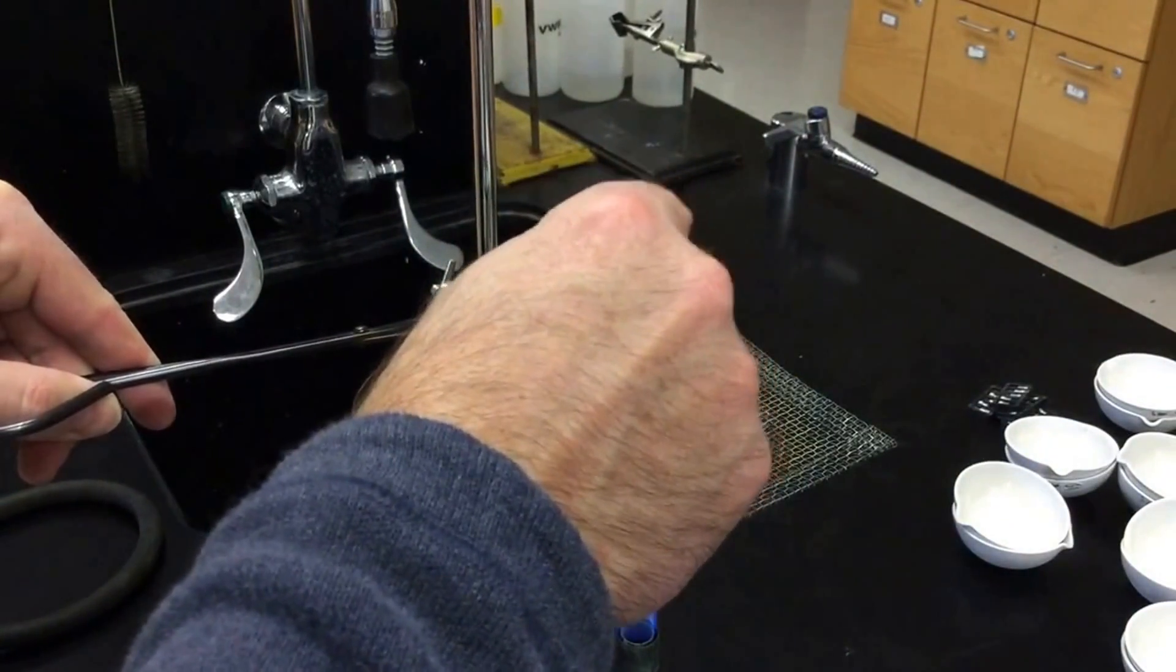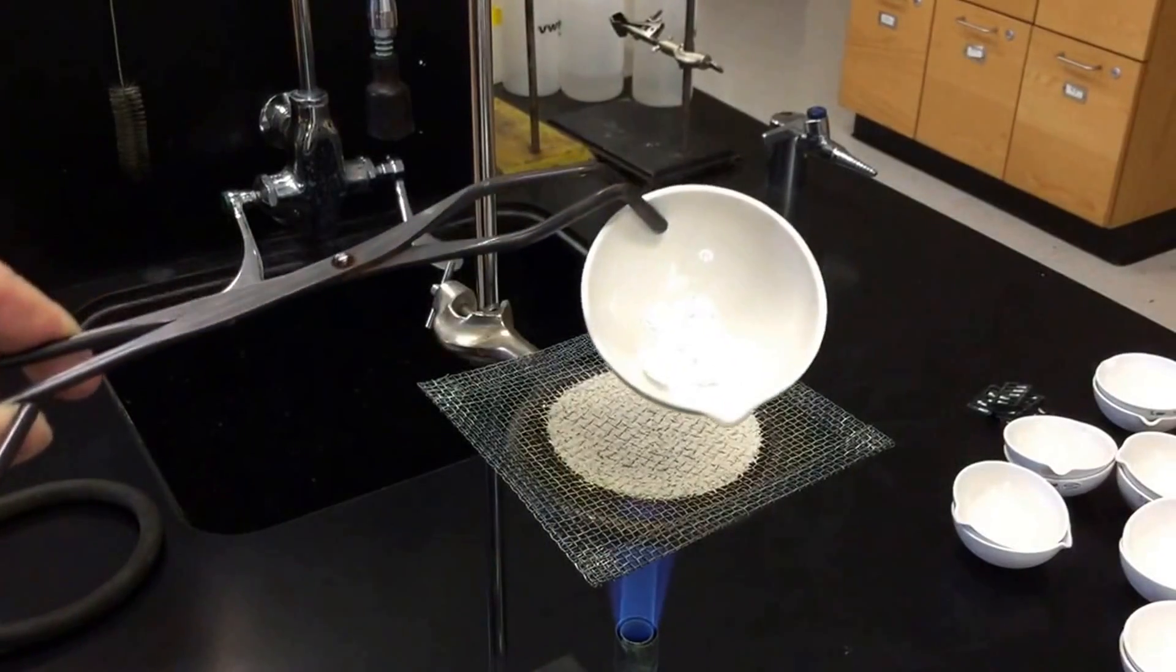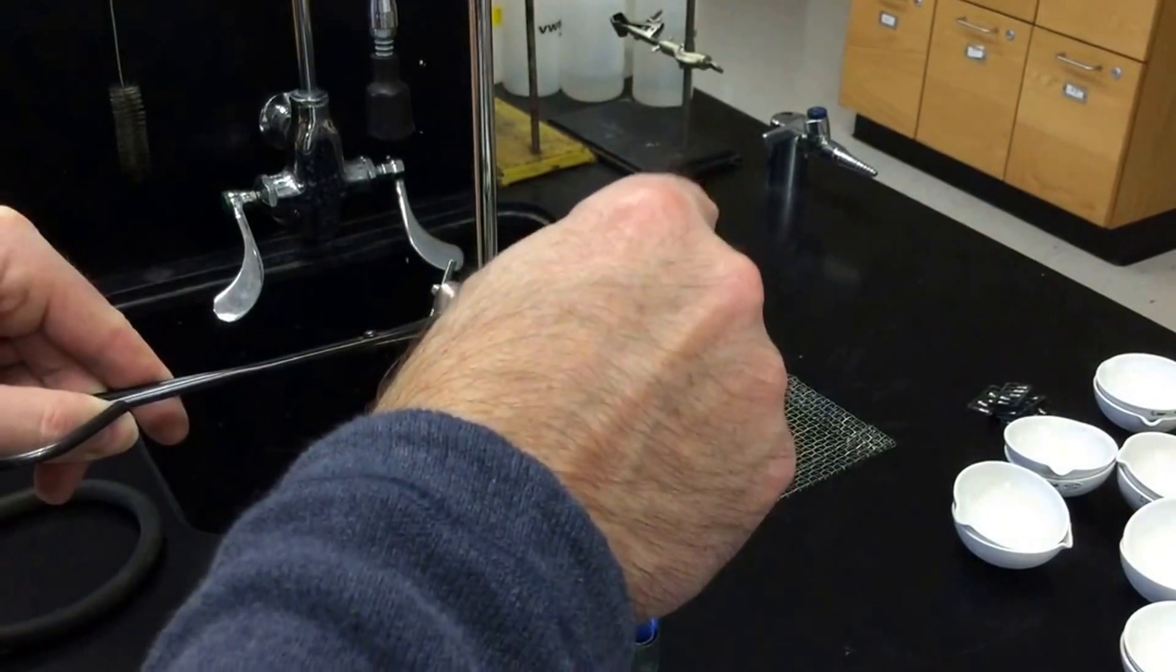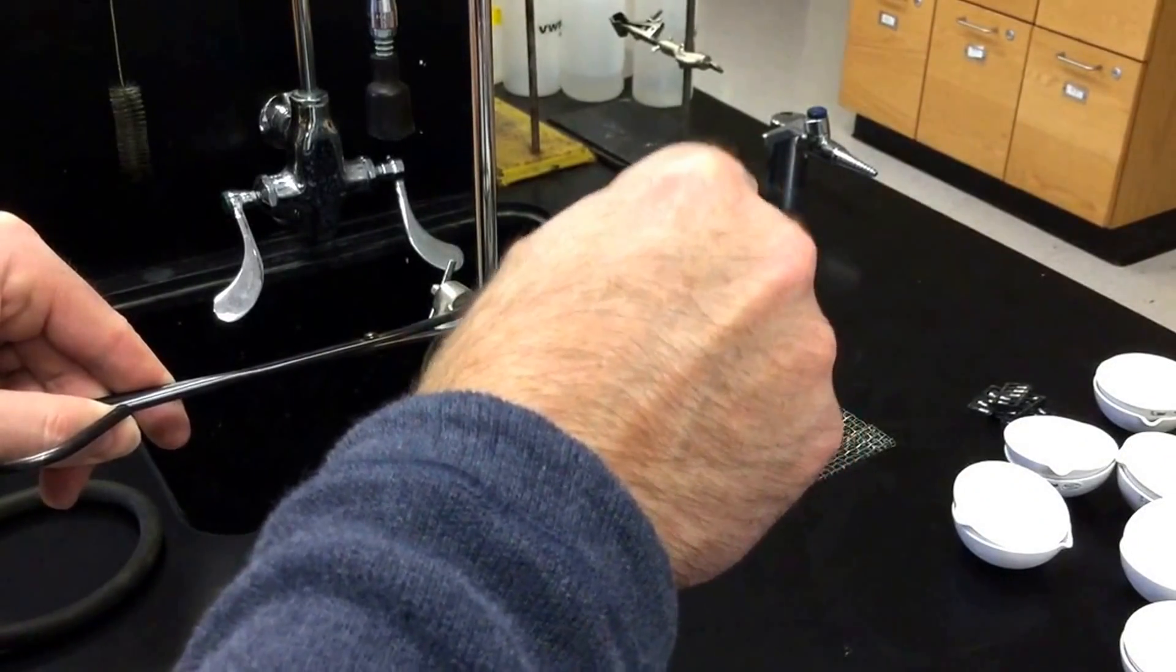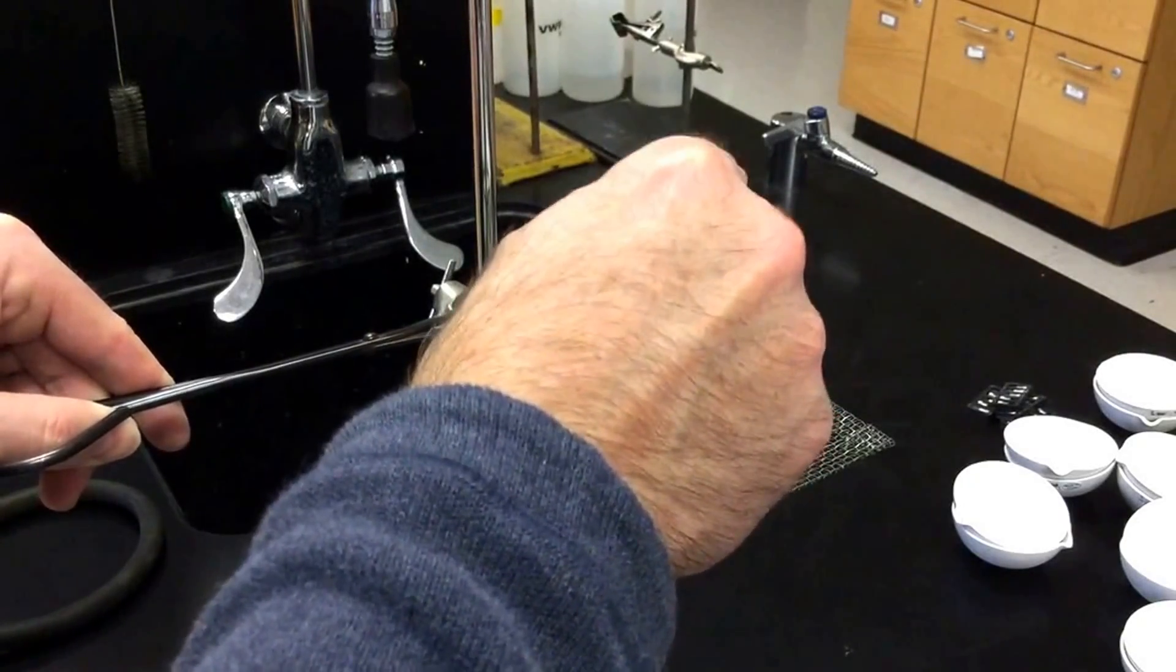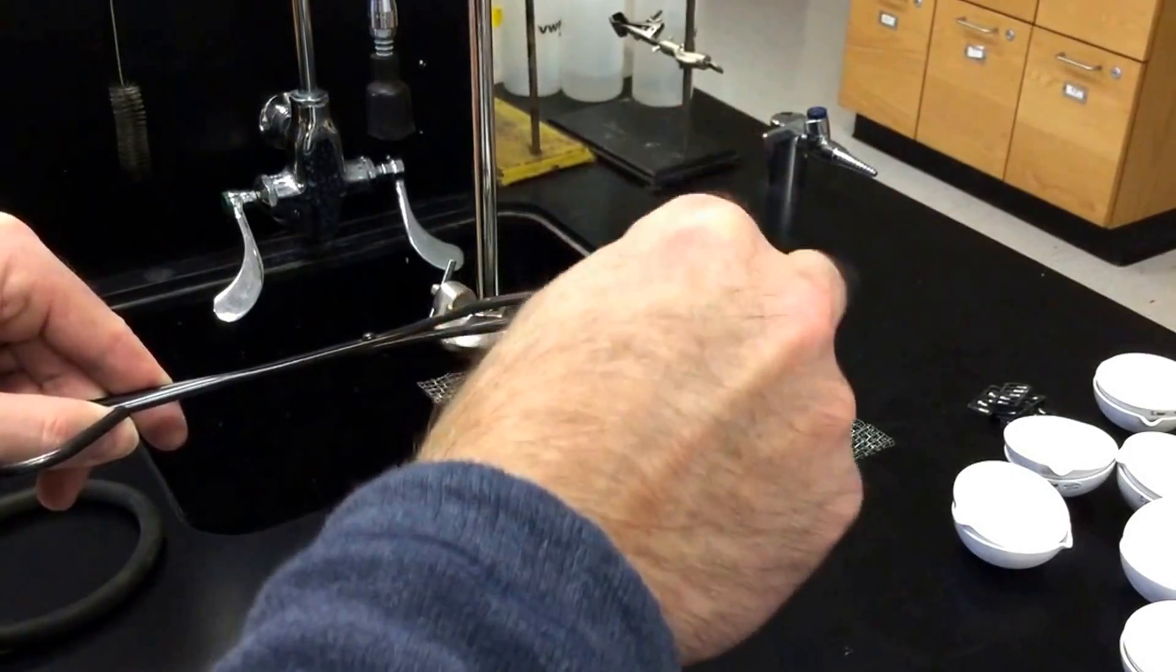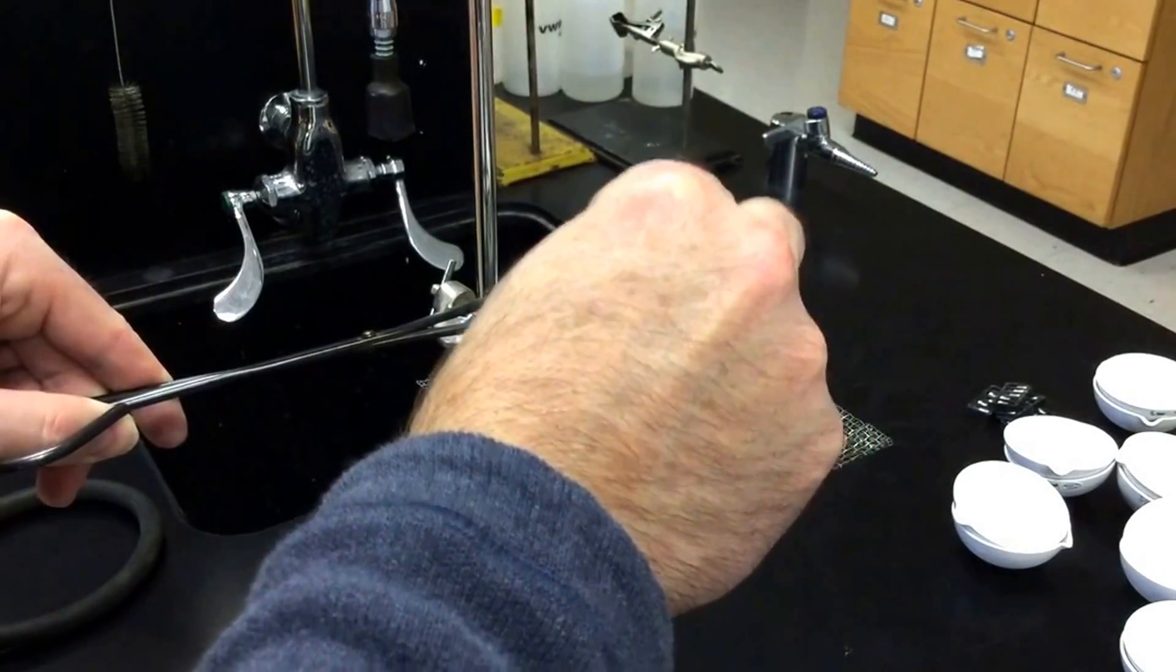What I want to do is just break up the clumps. And this is going to help, you can see the clumps broken up there now. What that's going to do is going to help heat this thoroughly and heat it evenly. Sometimes what happens is as we heat it, it clumps up and then some of the chemical in the interior remains unheated and unreacted.